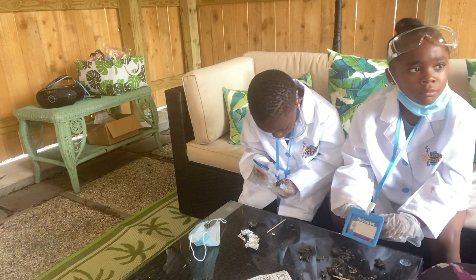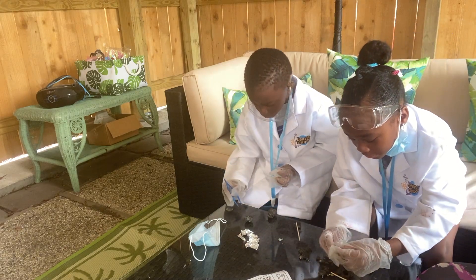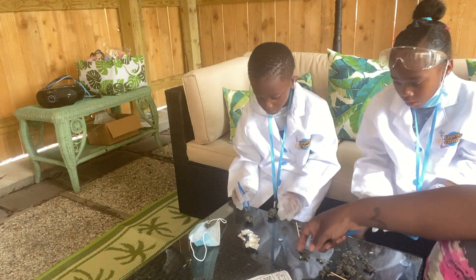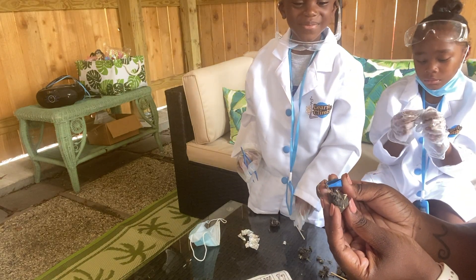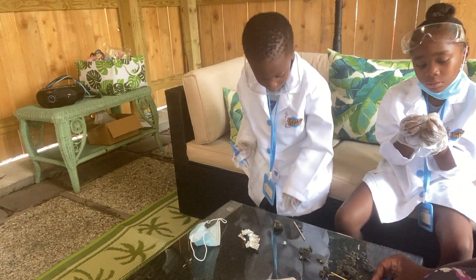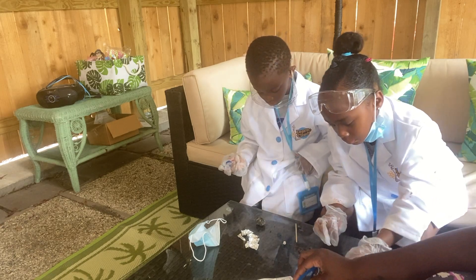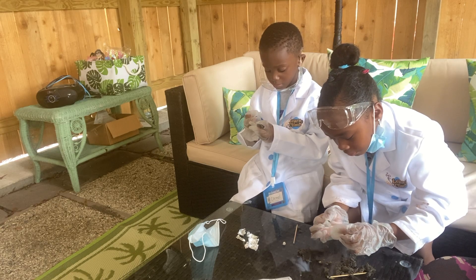That's interesting, huh? What if y'all ate your food like that — just ate the whole thing, bones and everything. I see a little bitty bone. I see another one. They regurgitated. Look at this little bitty bone. I see a bigger bone right there. All right, look at all these bones, Carmela. You have a lot. That looks like a leg. I got two bones. So look — that's what we're going to do. We're going to take the bones that we find and put them on a chart so we know exactly what's what.